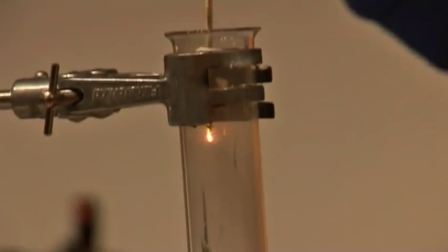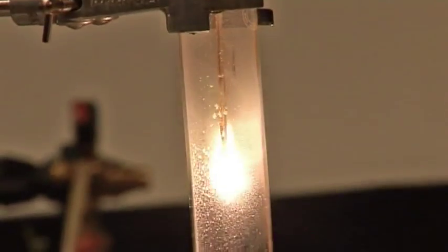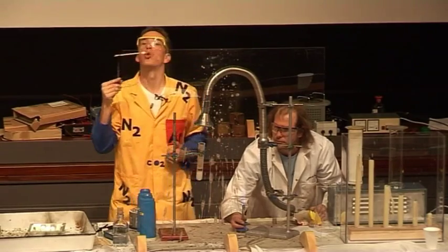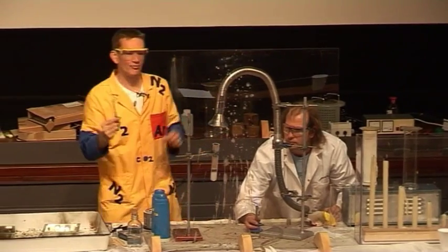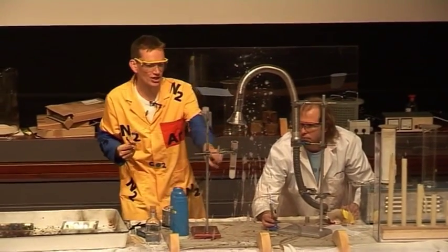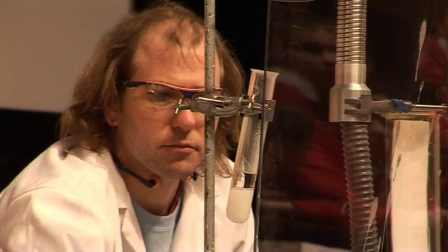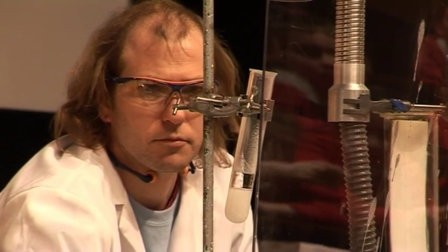So now it's out and now it's lit again, and that's a reaction from the oxygen that's coming out as the potassium chlorate decomposes.